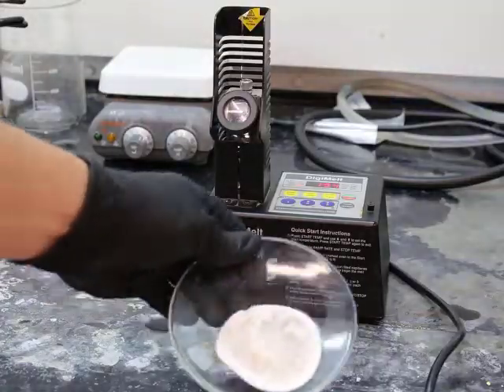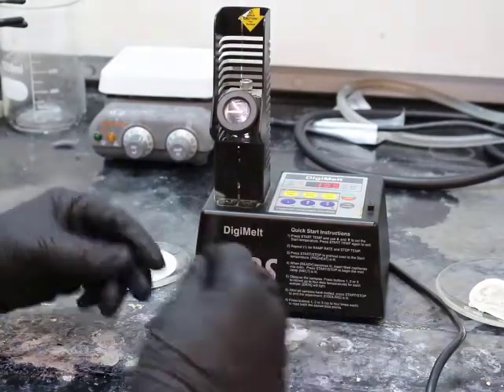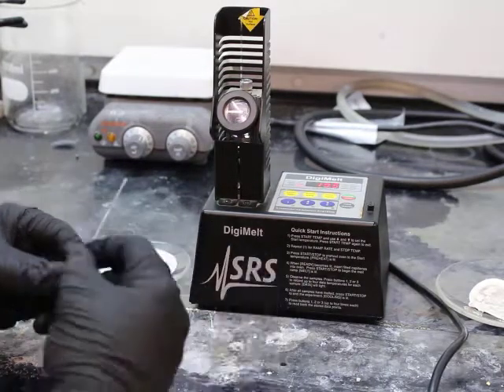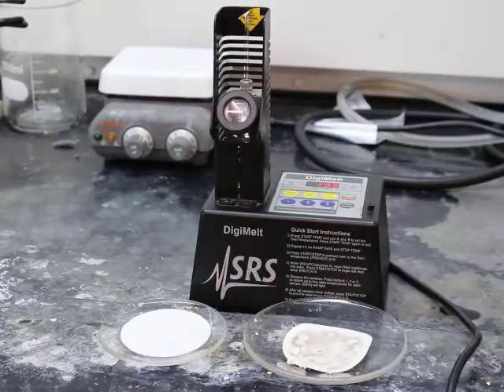What you saw is using the capillary tube, trying to get some of those solids in the capillary tube, and tapping the capillary tube to get some of that solid at the bottom. We have each one of our extracts in 2 different capillary tubes.